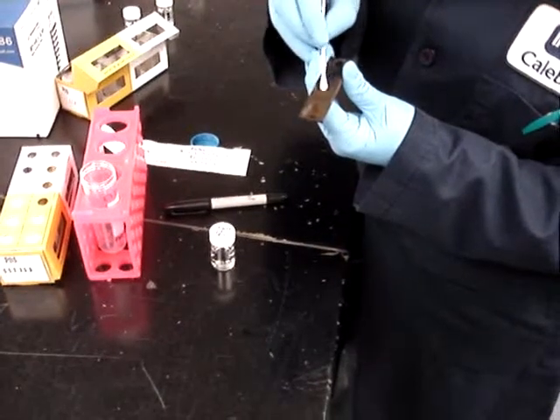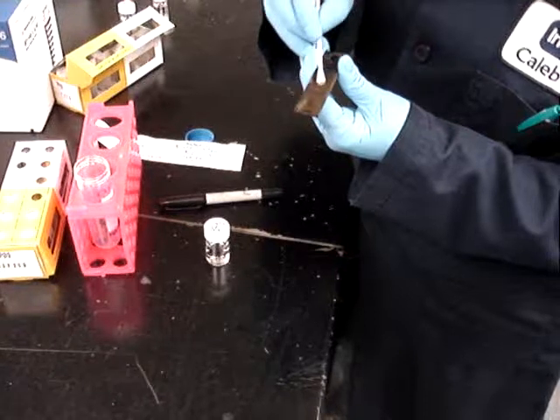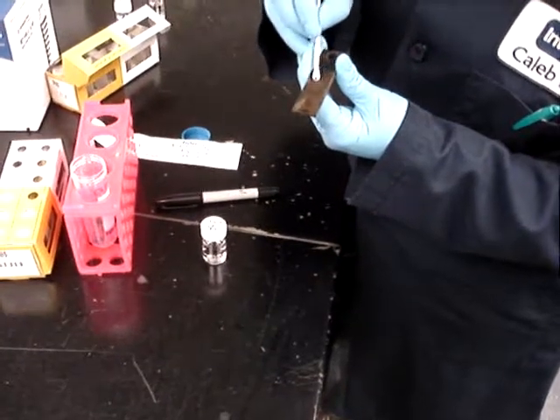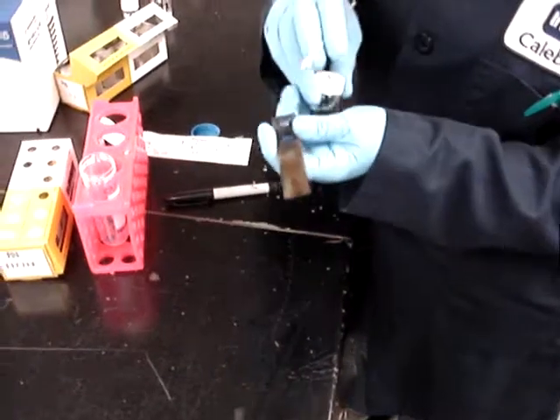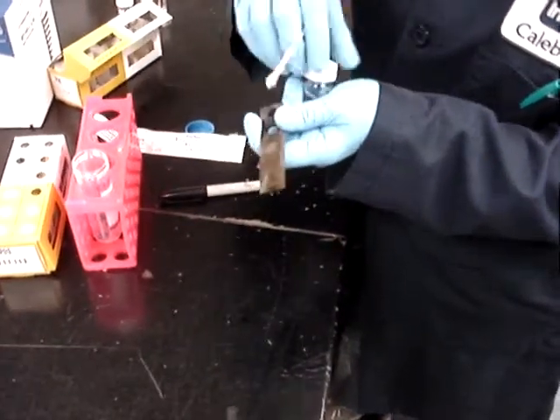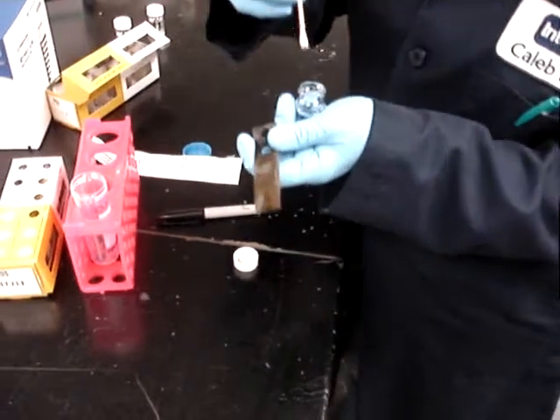That dry coupon is rolled and she uses all the surface of it to scrape an area about one centimeter squared. Then that recovered material is transferred into the preservative.